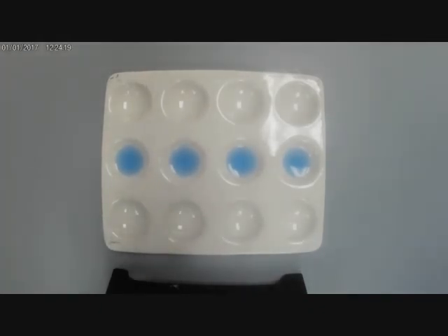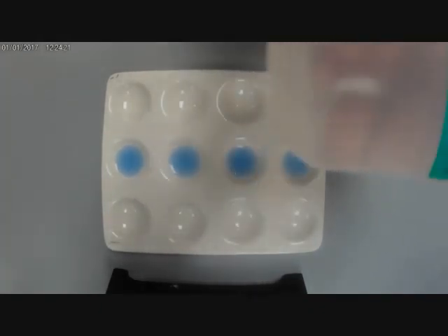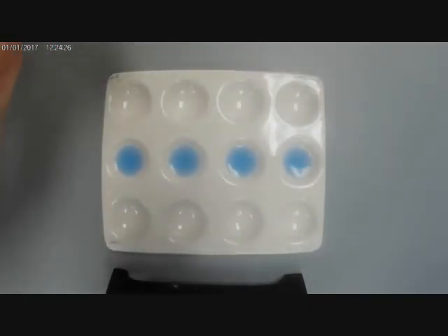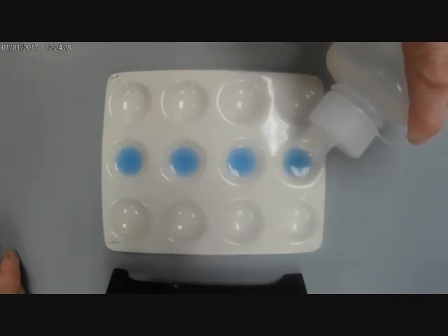Alright, so the solutions I'm going to test are water. This is going to be my first test. I'm going to put a couple drops of water into the first dimple.